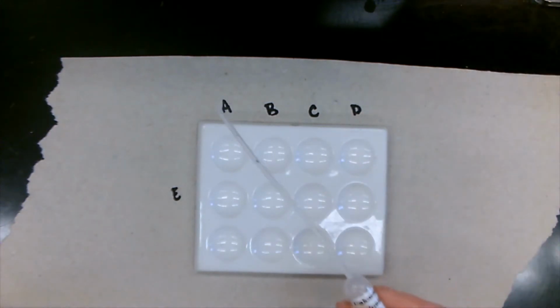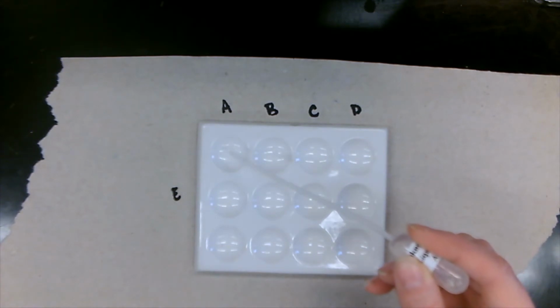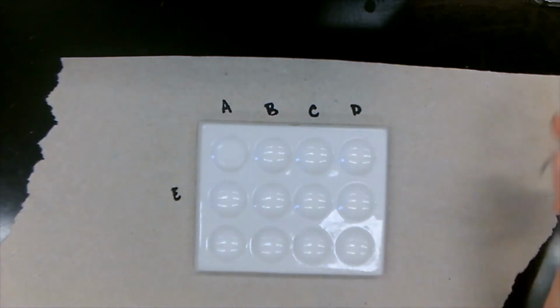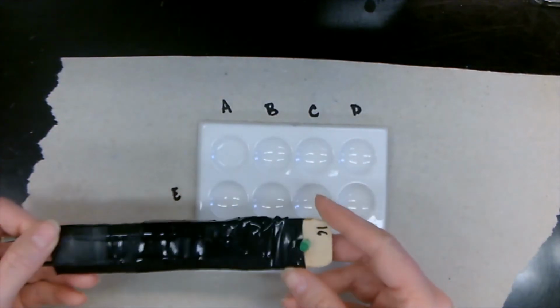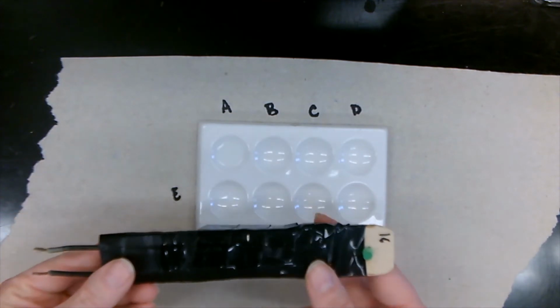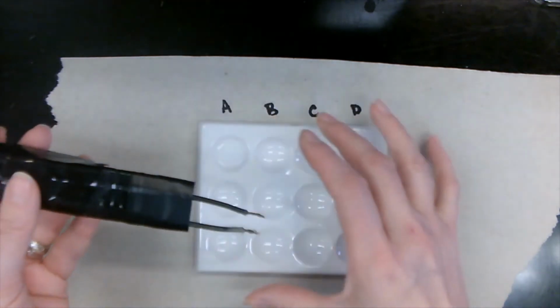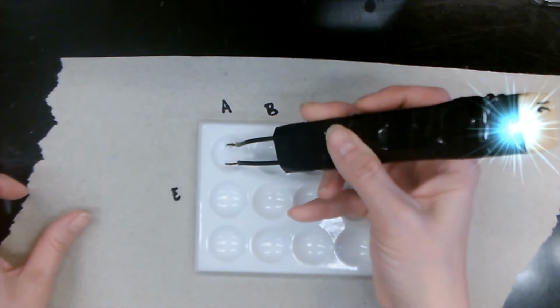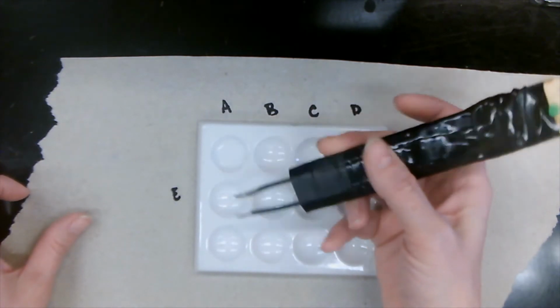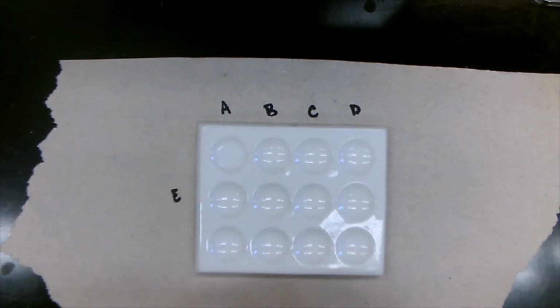So first, again, liquid A. We're starting with our liquid A. Let's add 5 drops. Now we have our electrical conductivity meter. If it conducts electricity, so if it's an electrolyte, the light should turn on. Let's see. Putting it in, and the light turns on. Excellent, so let's write that down. Light turns on. Now, make sure that we dry off those electrodes very well.